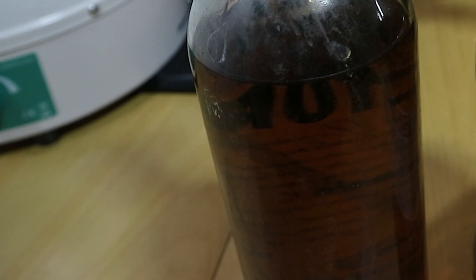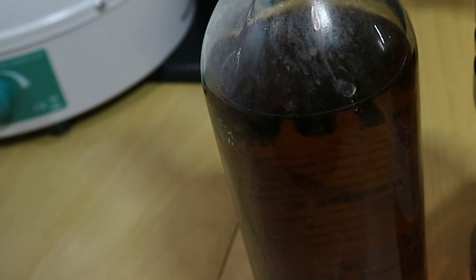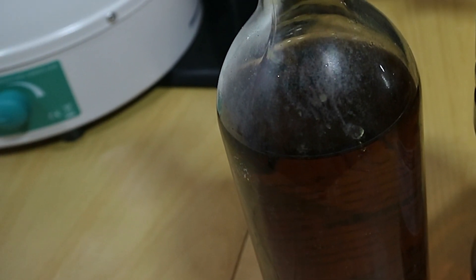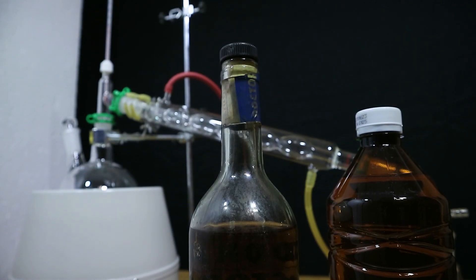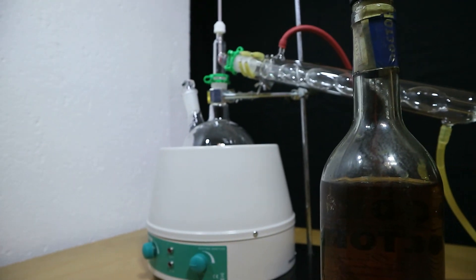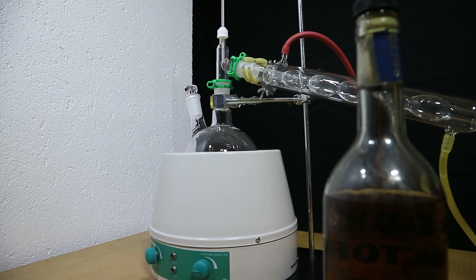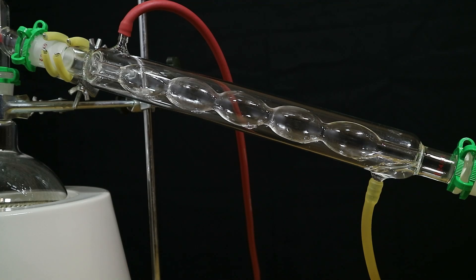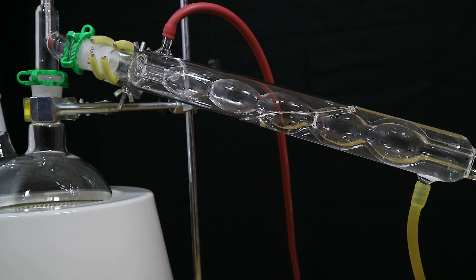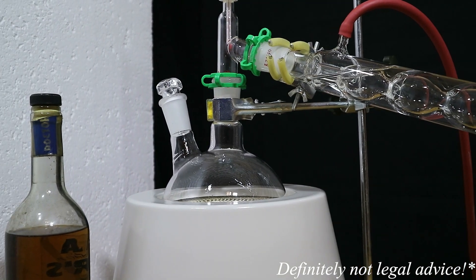Don't worry, the first step we will take is to get rid of this beautiful shade of brown. We're going to use distillation, the thing which is apparently still illegal to do in a lot of places around the world unless you pay your taxes for it because you know everything is legal if you pay for it and get a receipt.